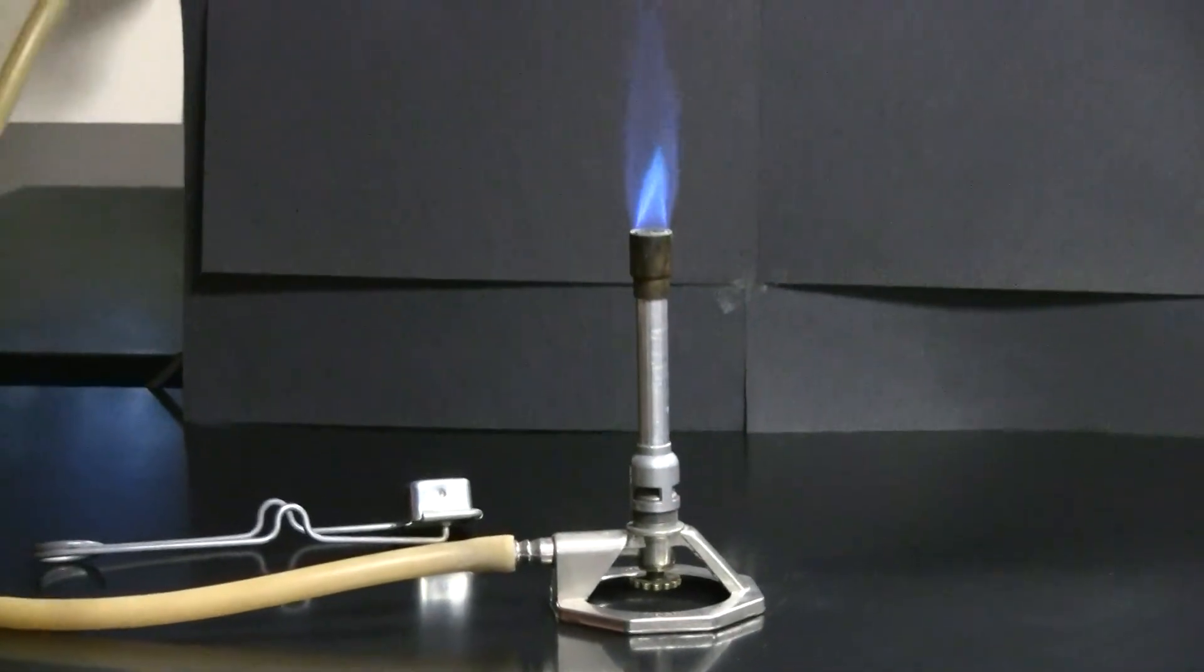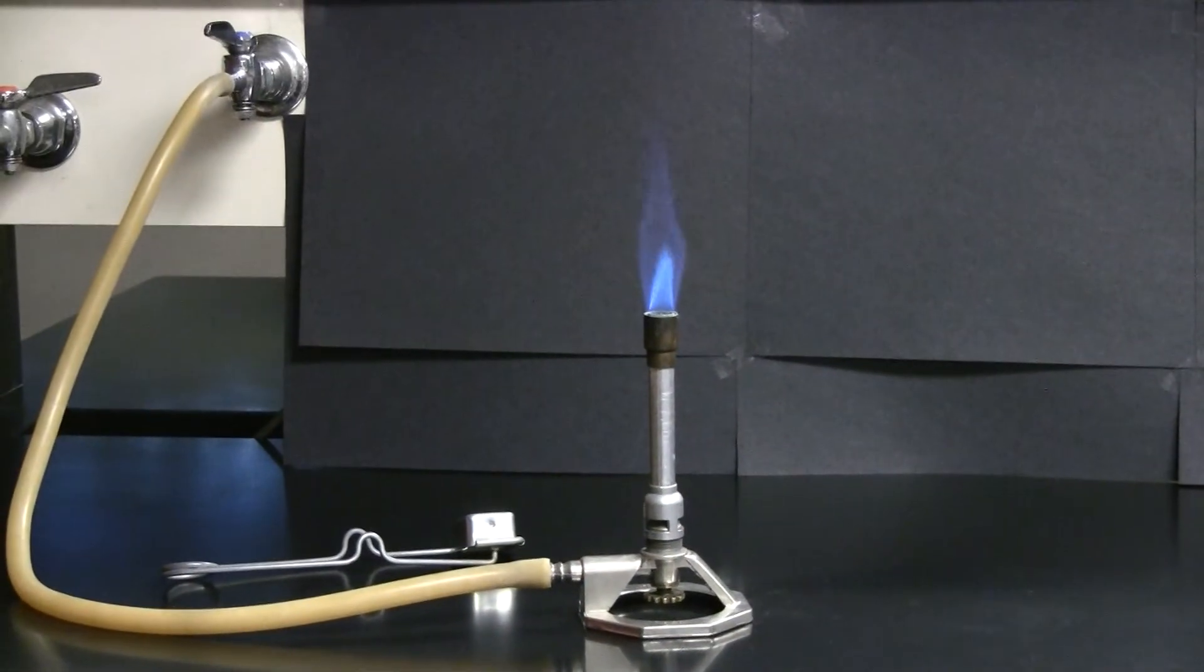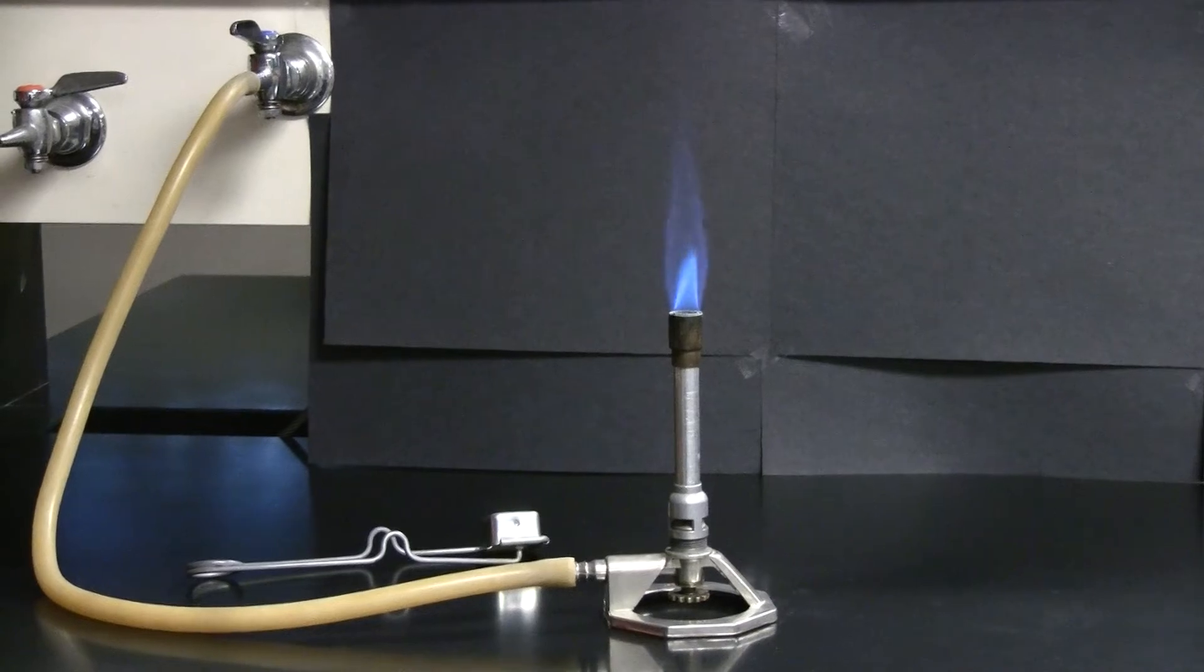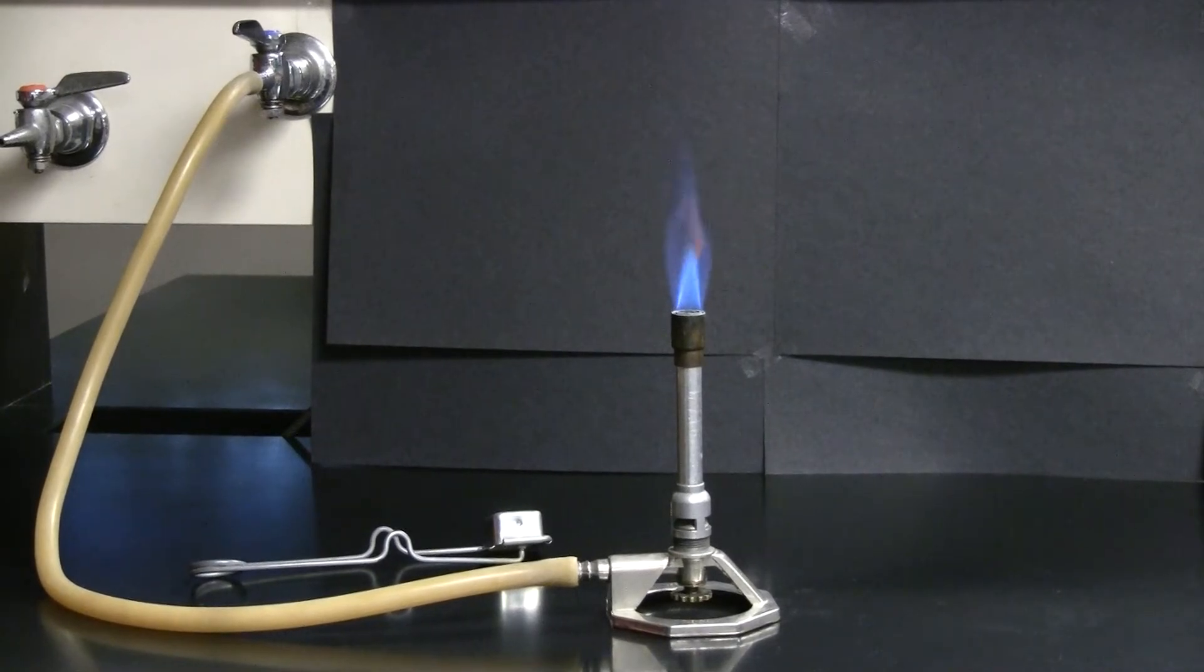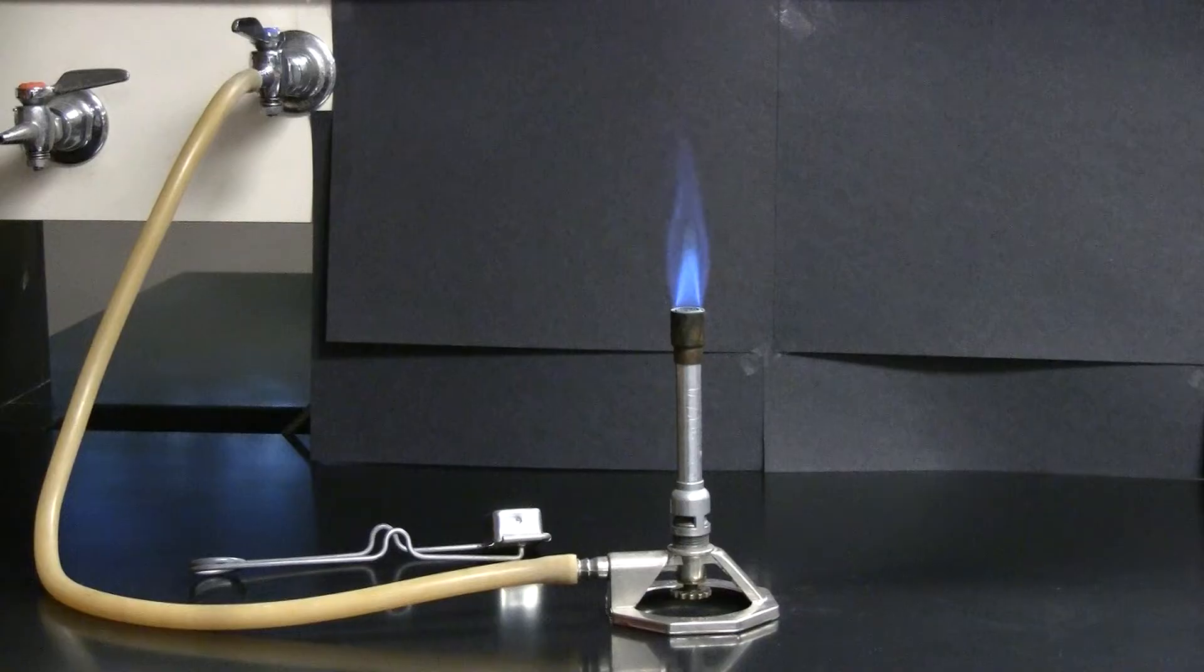Once you have a properly adjusted flame, you should be able to hear it sputtering. This indicates that it's a strong flame with an appropriate air-gas mixture so that it won't blow out if people are walking by.